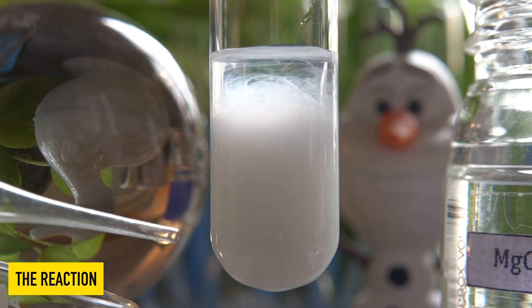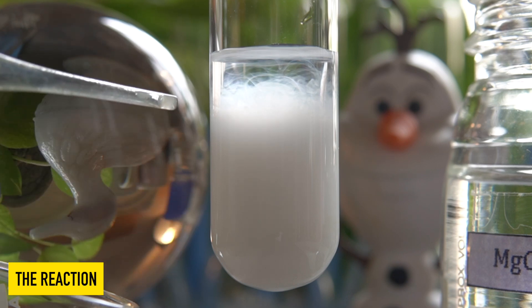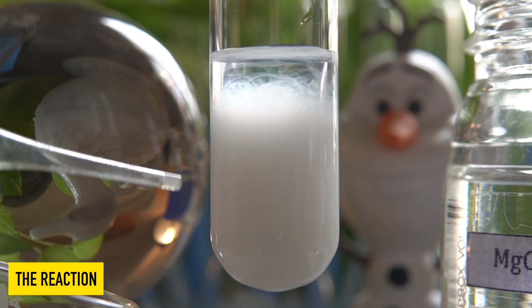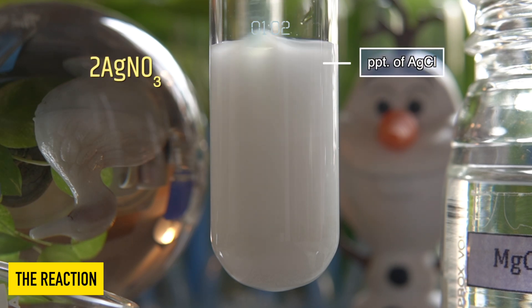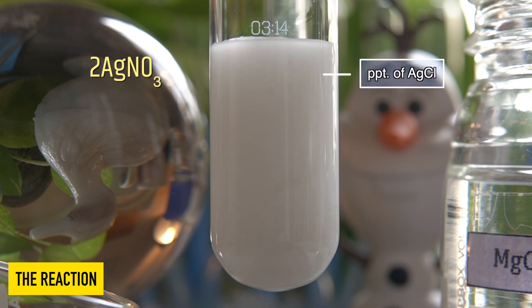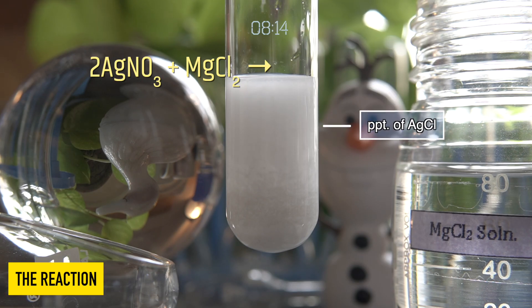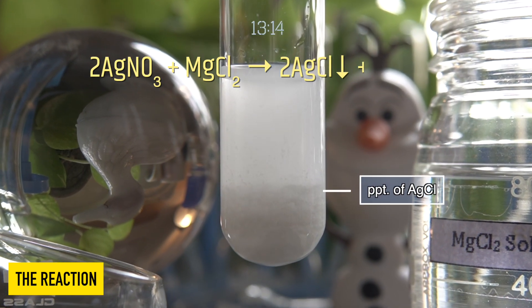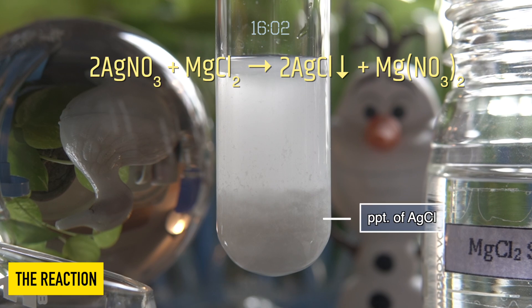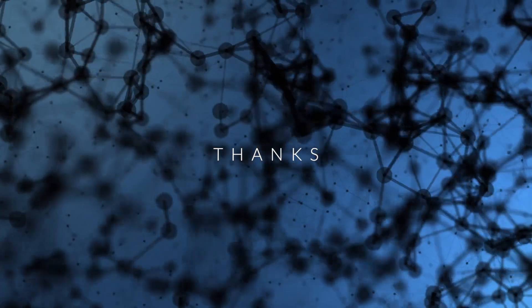The insoluble white precipitate that has been formed at the bottom of the test tube is nothing but silver chloride. In this reaction, silver nitrate reacts with magnesium chloride to produce an insoluble white precipitate of silver chloride along with magnesium nitrate. This beautiful precipitation reaction is a good example of a double displacement reaction.